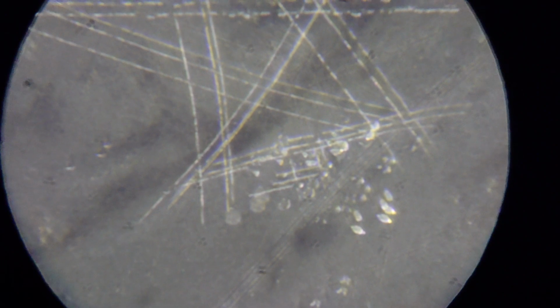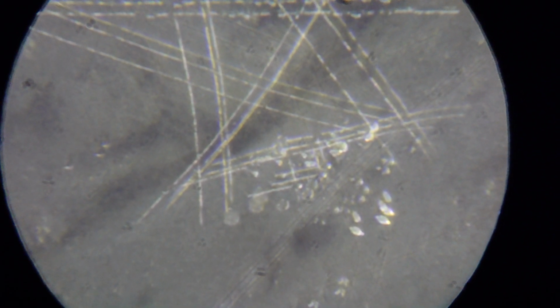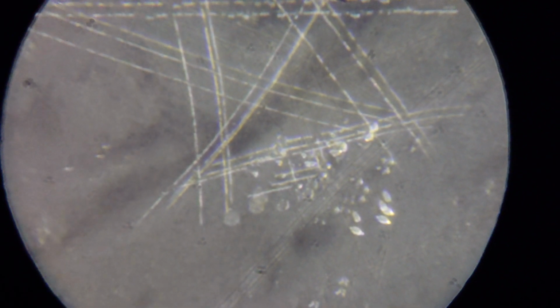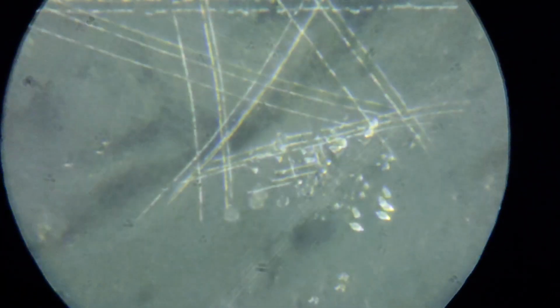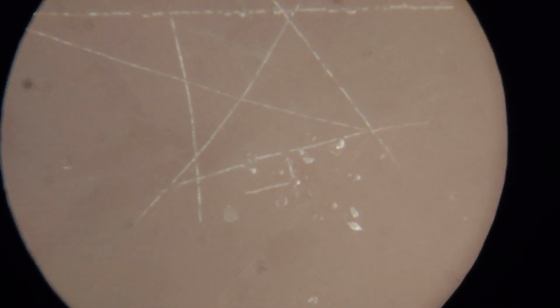magnification a bit higher. So in one of the positions we can see all three channels went to a sharp focus. Here's our left channel, here's our photo channel, and here's our right channel. All three channels are well focused here. I would say no errors at all, but we could easily see huge misalignment. Not that good for nice working.